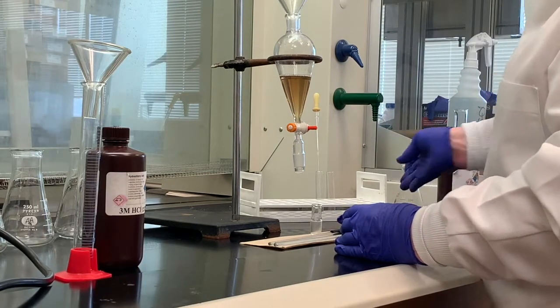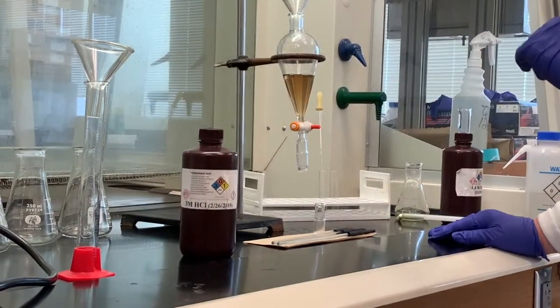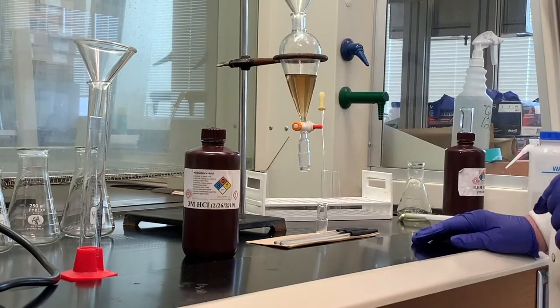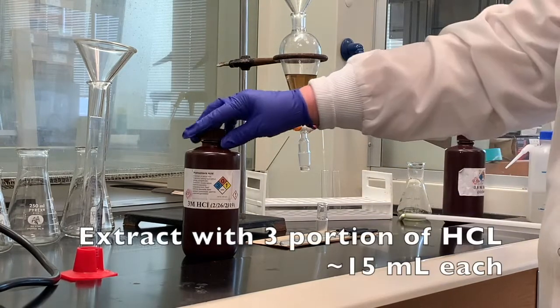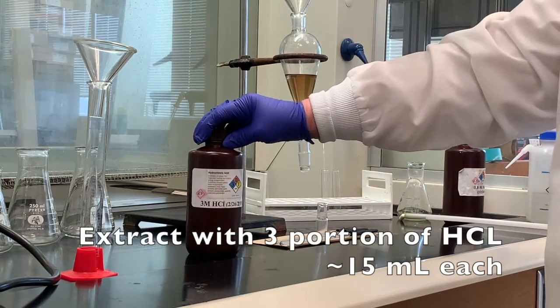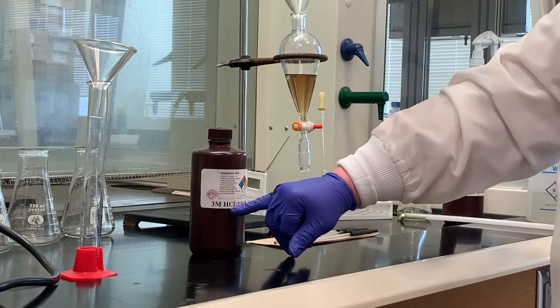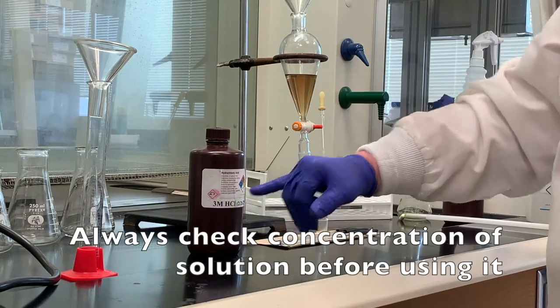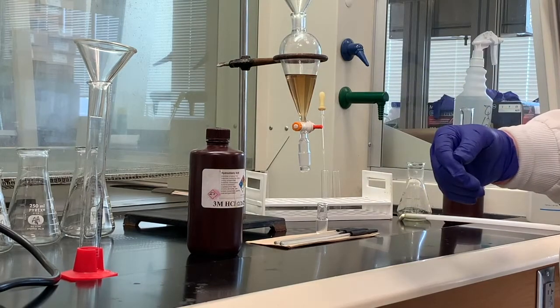And then the first thing we're going to do is take the 3 molar HCl and add it to the components, this mixture, the organic substances inside the separatory funnel. A lot of times when you do extractions, the rule of thumb is at least twice, sometimes 3 times. We're going to use 3 15 milliliter portions of the hydrochloric acid. And we're going to use another hydrochloric acid solution later when we want to isolate the substance from the aqueous base. Make sure you always double check. We want 3 molar to do the extraction process. We'll use something more concentrated when we do the precipitation process.